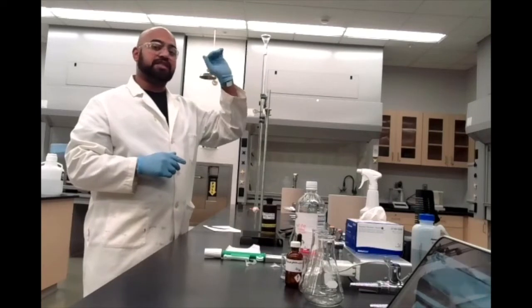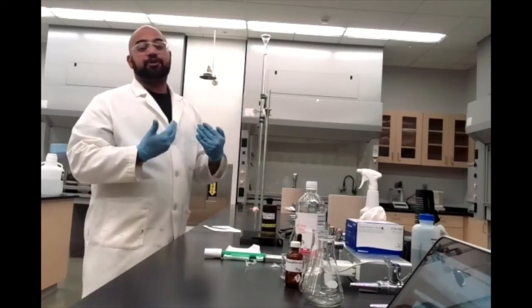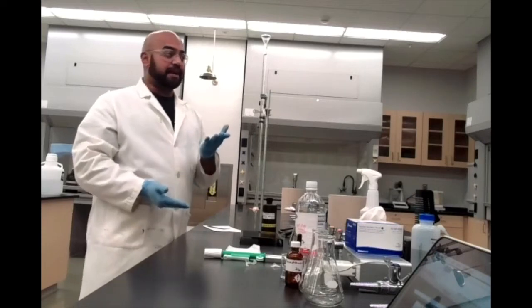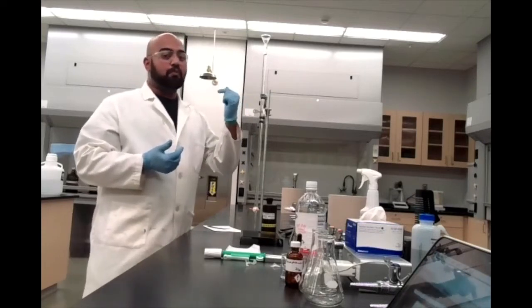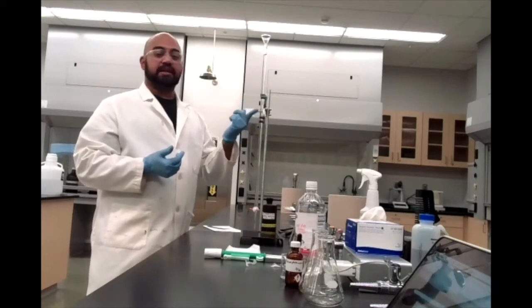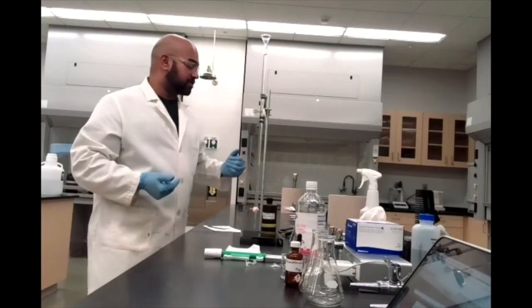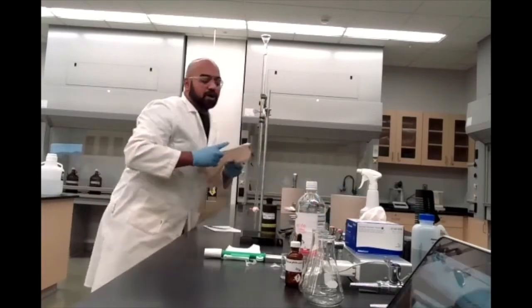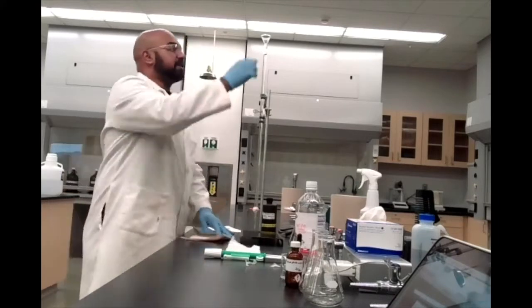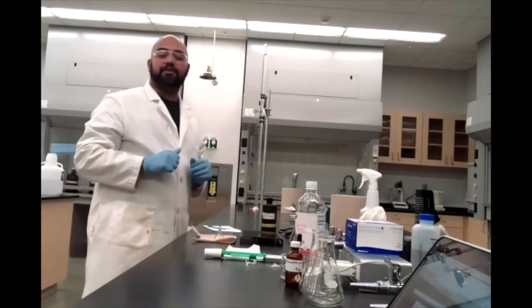Sometimes sodium hydroxide sticks to your funnel and it might drip into your burette after you've made a reading, and then, before you make your next reading, you have more sodium hydroxide in there than you think, and that affects your results and your calculations. So we're going to take off our funnel. I'm just going to set it down here on this paper towel. Okay, leave that there for now.